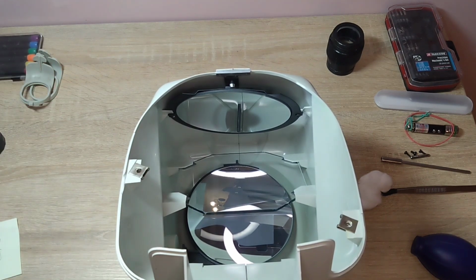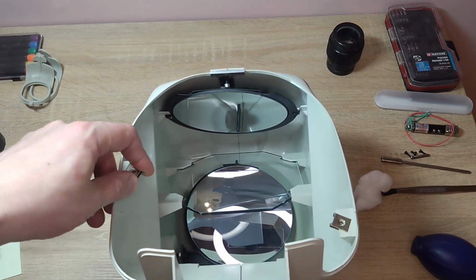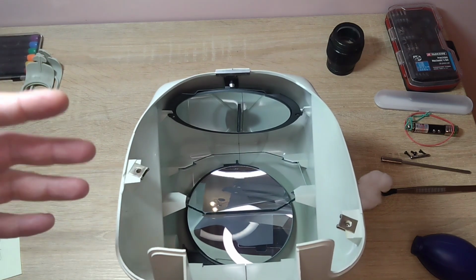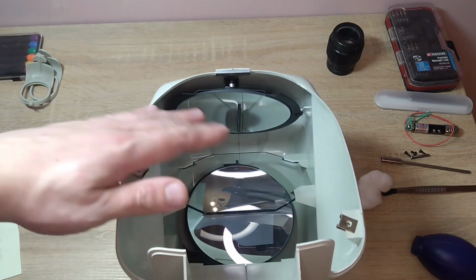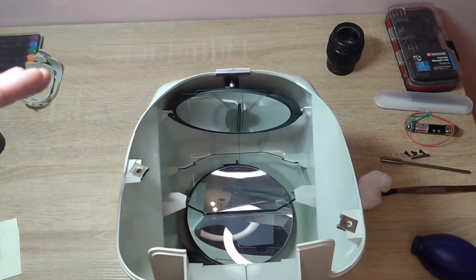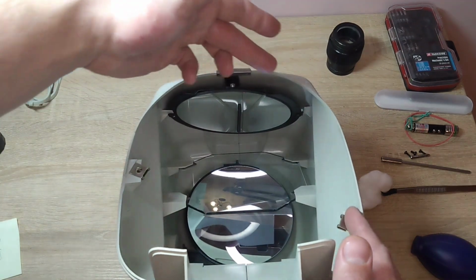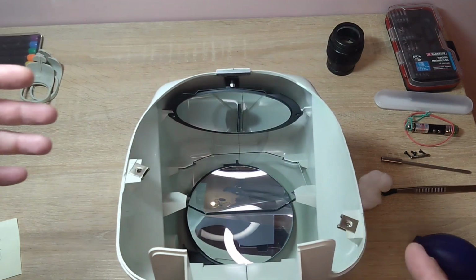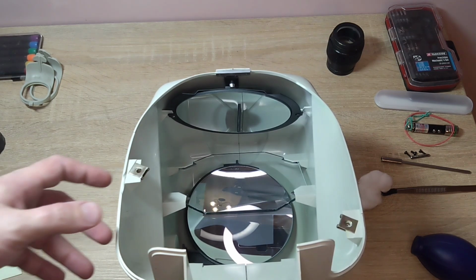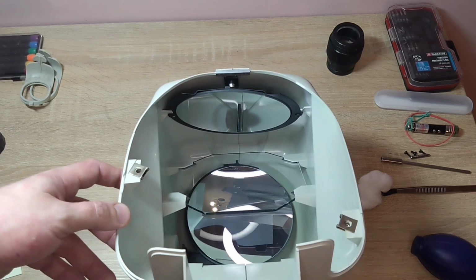In short, I have serious doubts about how much this can be adjusted at home. First of all, it needed to be cleaned, and I cleaned it. I wiped everything with a cotton pad here too, and now I believe that the most important thing is to mount it in such a way that there are no problems. You see, there is a broken mount there. I think to myself, I'm still not sure if everything is assembled and glued. Maybe the doubling effect will disappear.